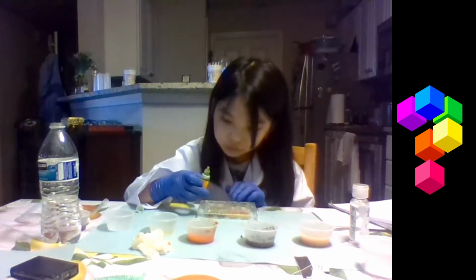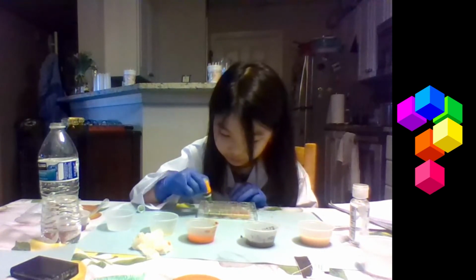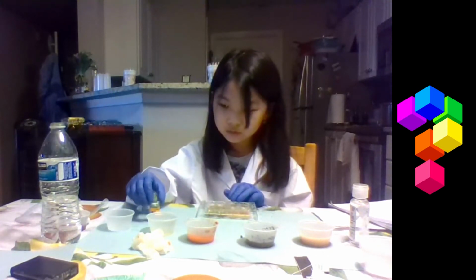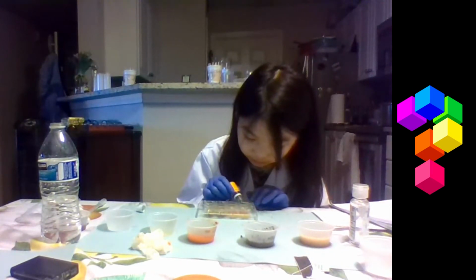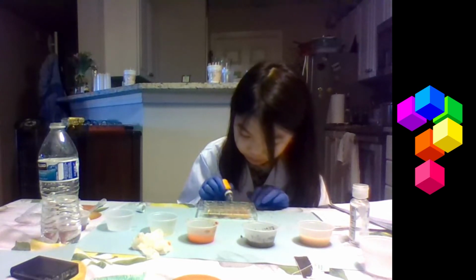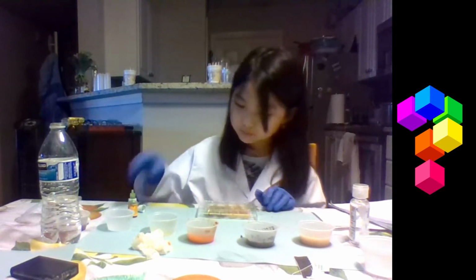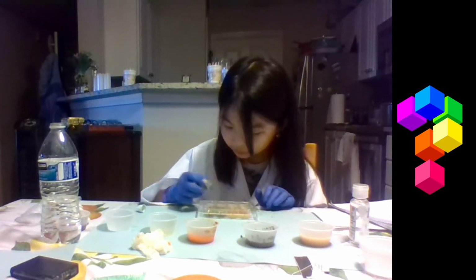The collagen, which I thought was going to be base, is the color of yellow. It's yellow, which means it's also acidic. The sanitizer's next. It's a 3. It's reddish. And last but not least, the wine. It's a 1.